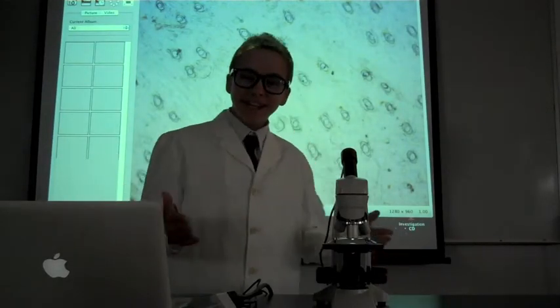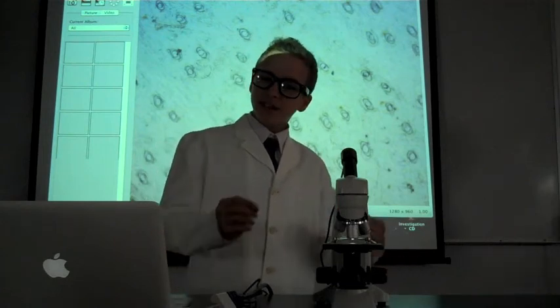Hi, today we'll be looking at the underside of a leaf at the stomata, which is the holes of a leaf that allow water to come in and out.